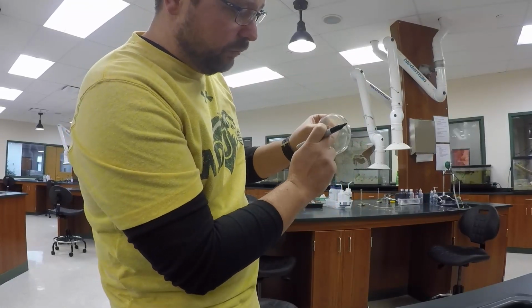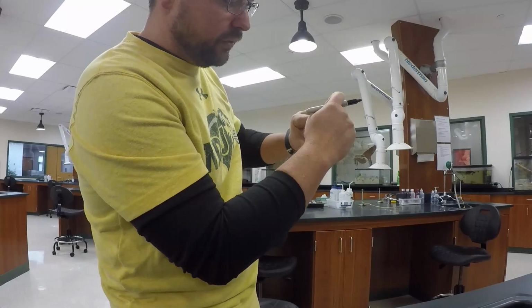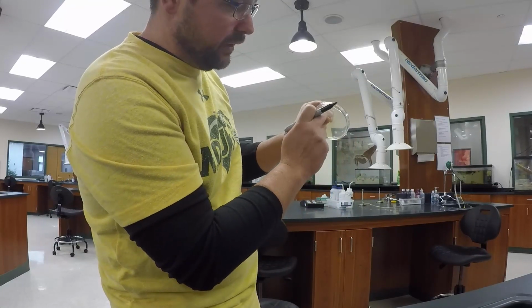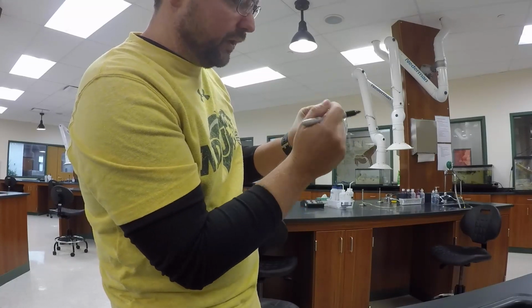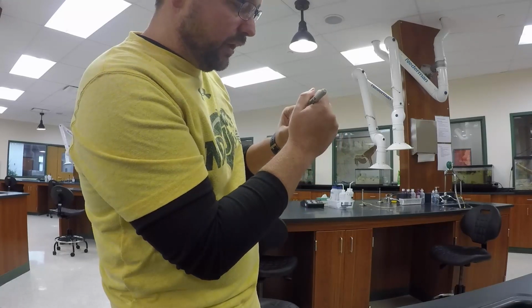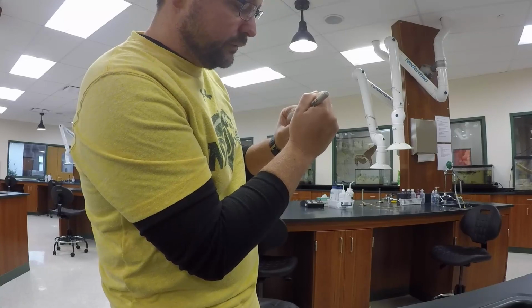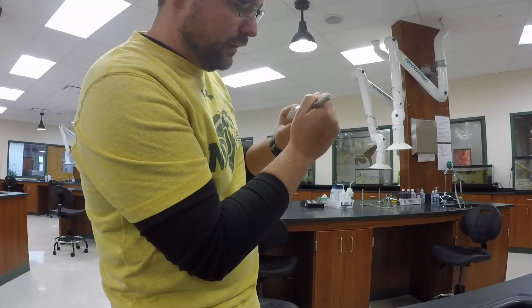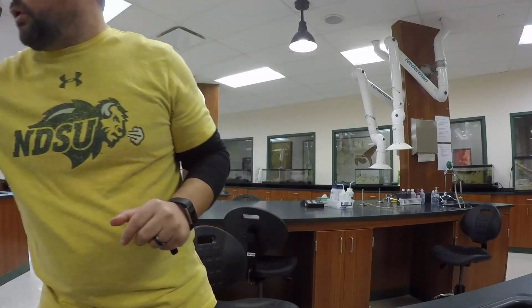And you don't really want to write on the bottom of the dish, because what will happen is you're going to be looking at bacteria on here, and any color or anything that you write on the bottom will make it harder to distinguish what's inside. So I'm just going to write here, light switch, and that gives me an idea that is what I swabbed.